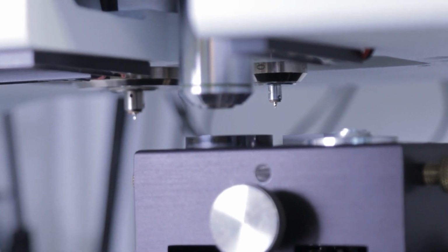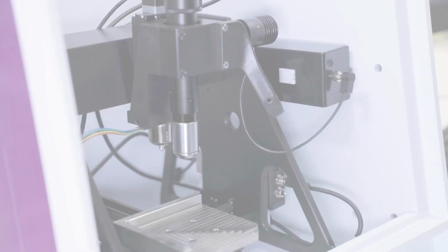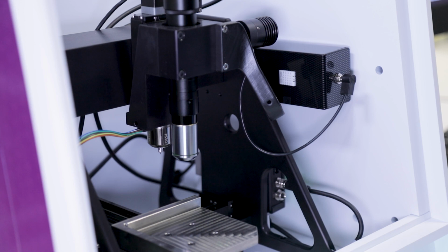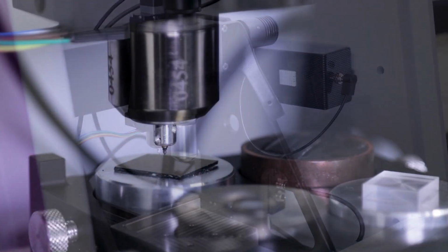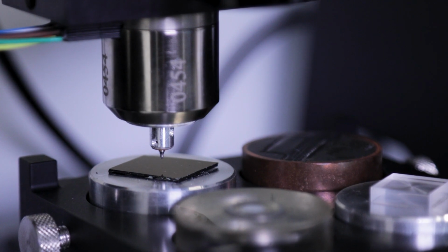For the nanoindenters, our core technology uses an electromagnetic actuation and a 3 parallel plate capacitor for measuring displacement. Both of these combined together allow us to optimize the measurement of both load and also displacement. These are fundamental measurements for nanoindentation.